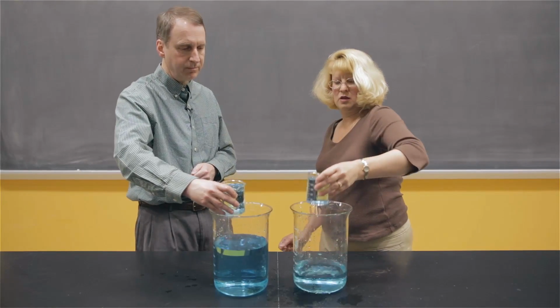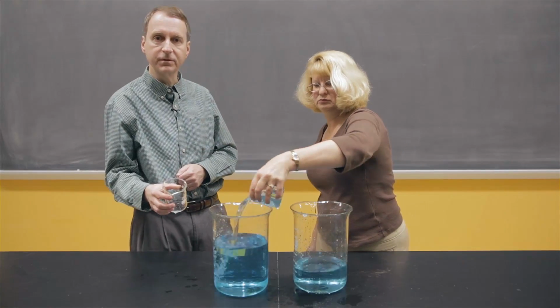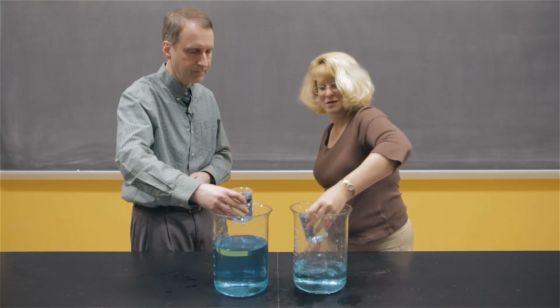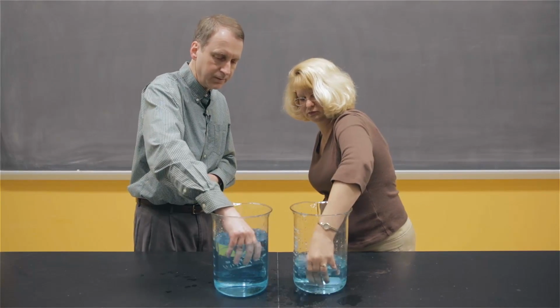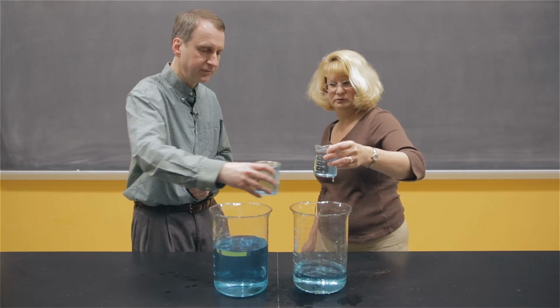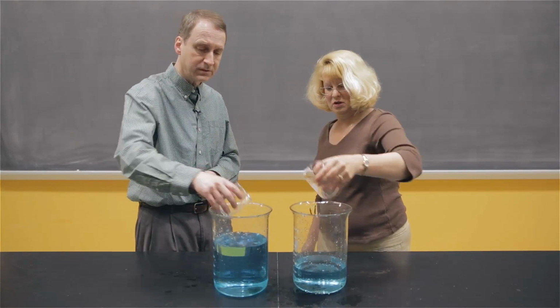Again, the levels in the big beakers are changing, but ever so slightly now, because we're almost transferring the same amount. Now, we're just about at the point where we're transferring the same amount. And let's keep going. When we do get exactly the same amount, a full 250 milliliters, we'll notice a couple of characteristics about this system.